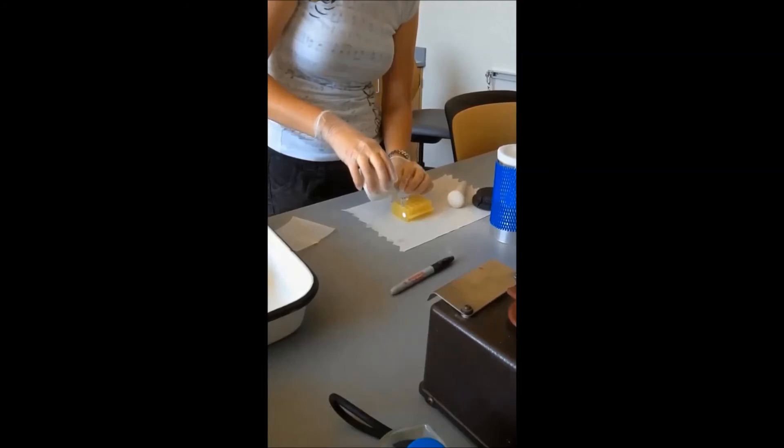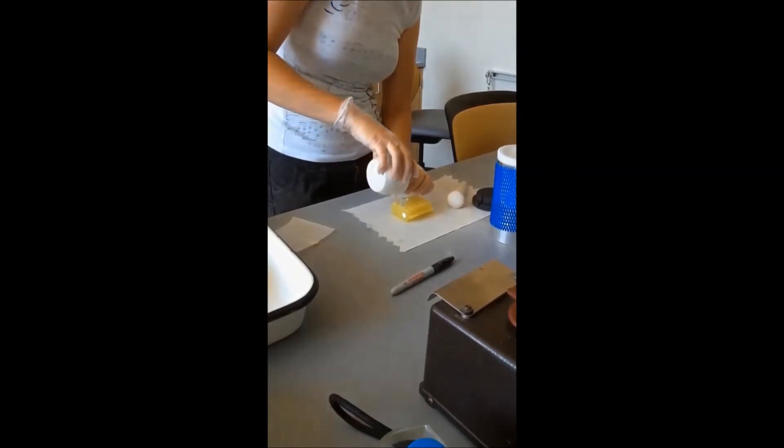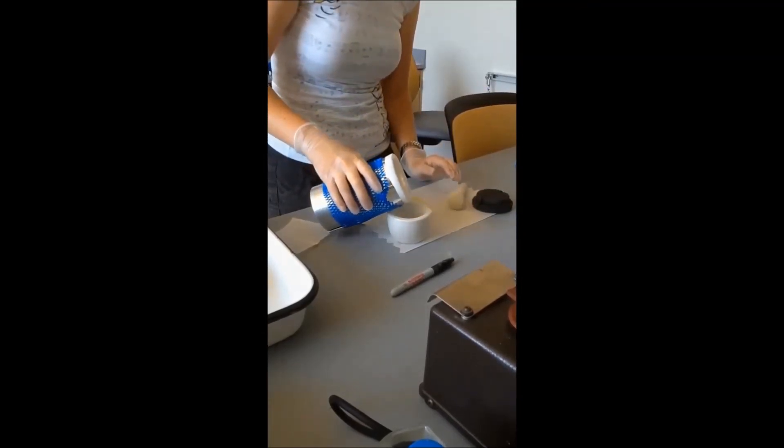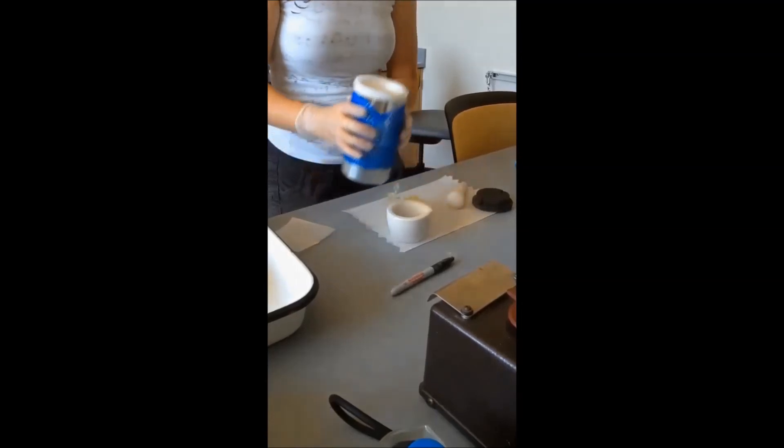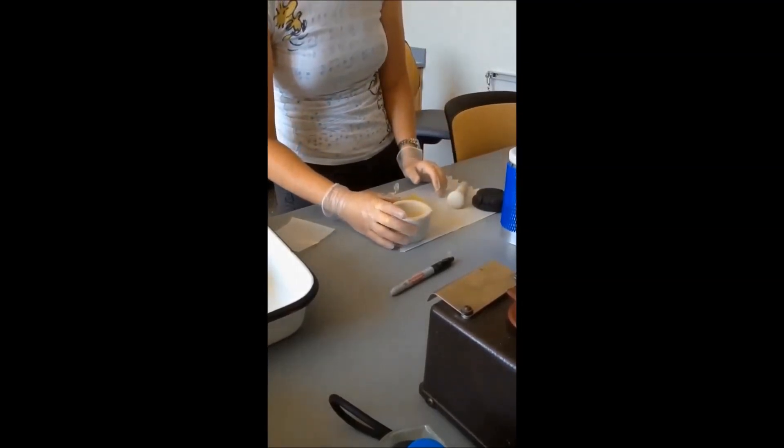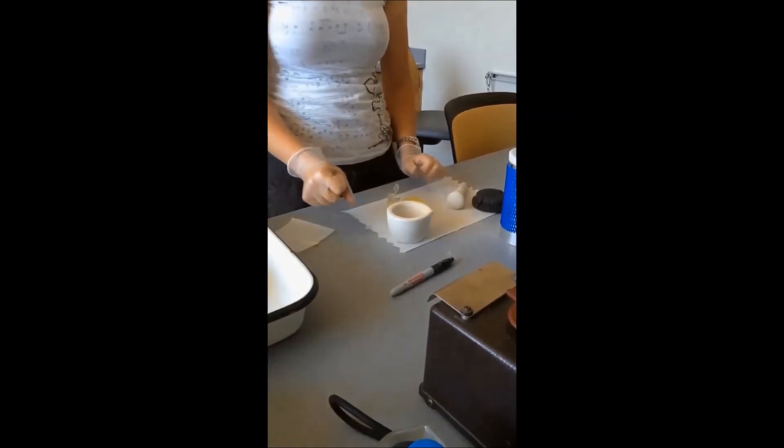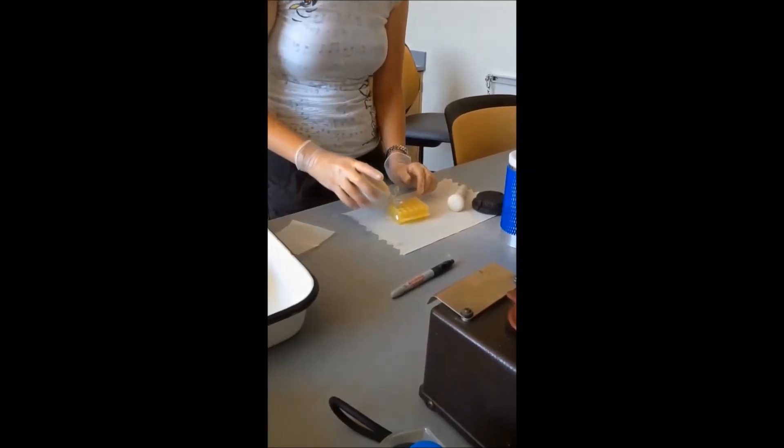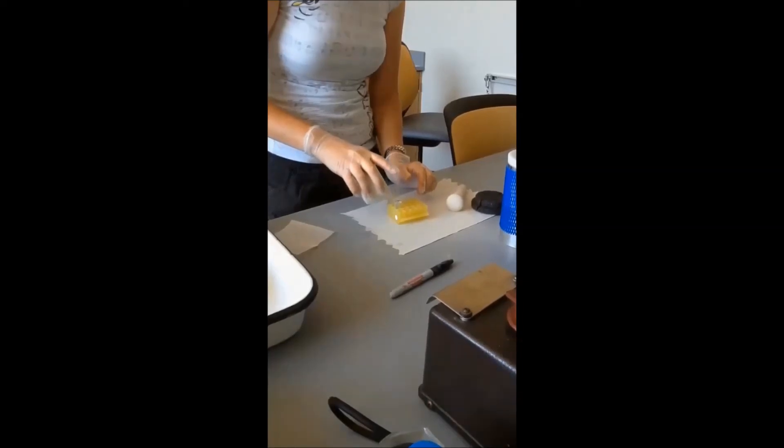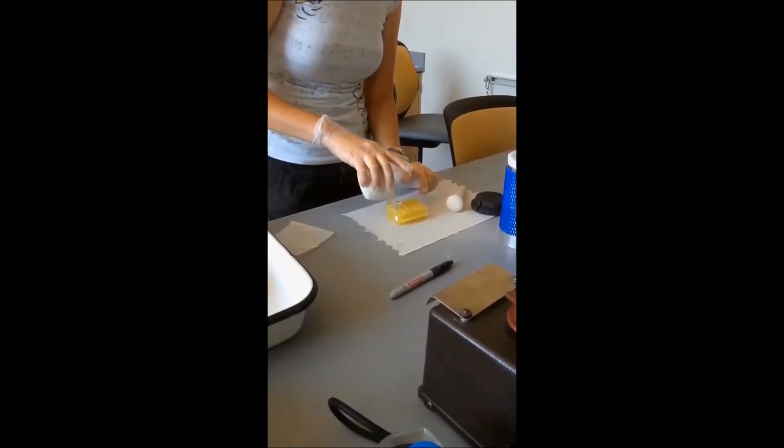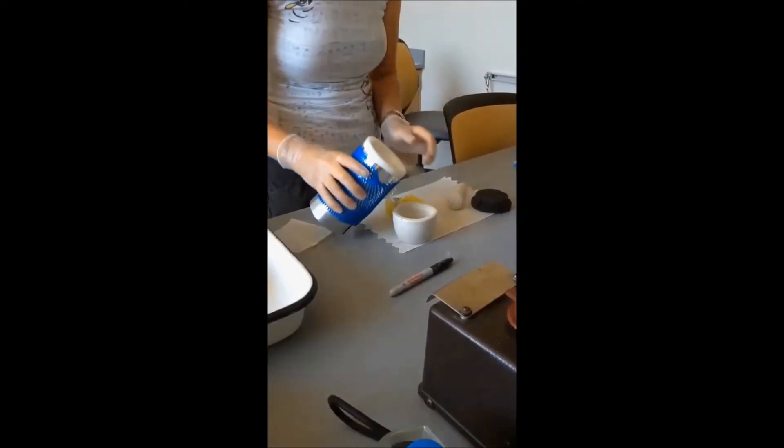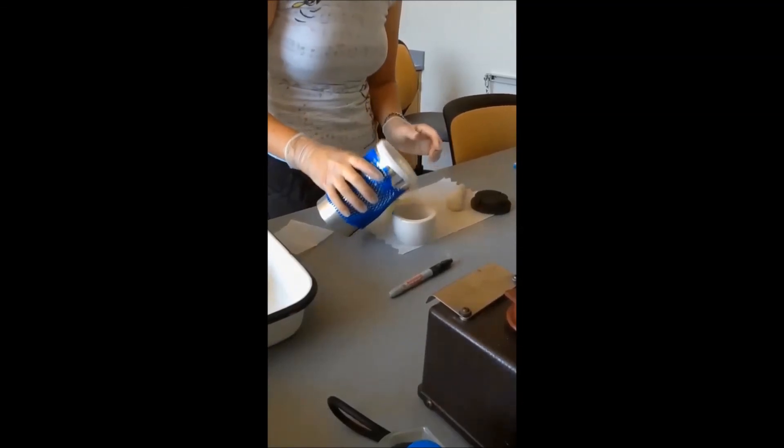And we have just a little bit more, so we'll just continue this until we get all of the last half of it transferred. Just a tiny little bit left so that we get as much of our sample as possible.